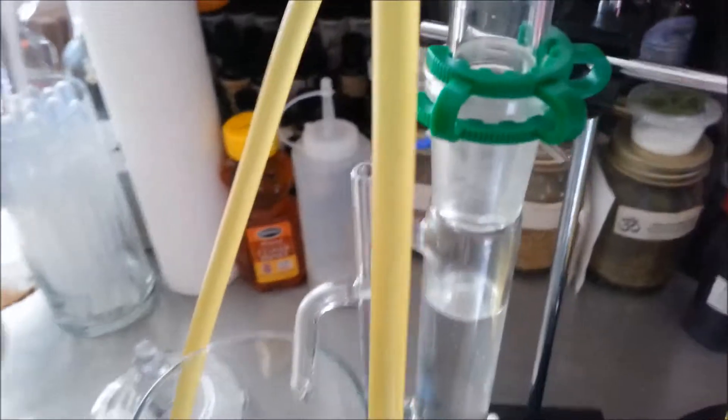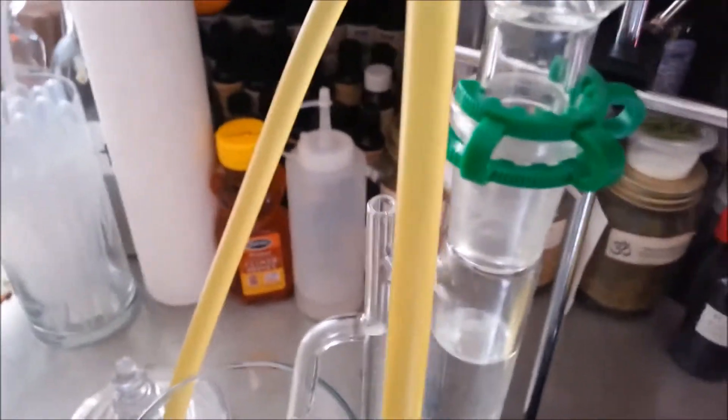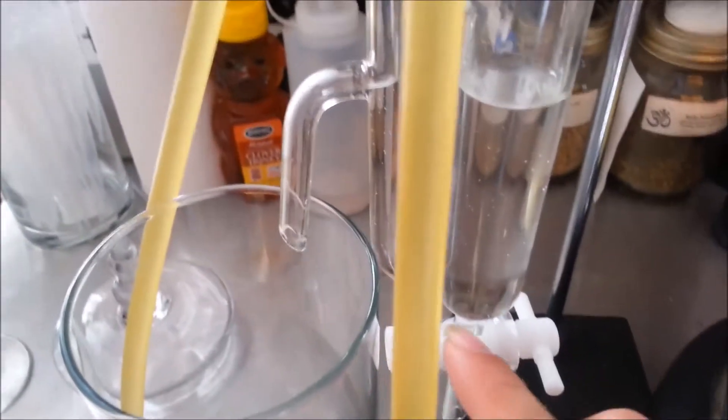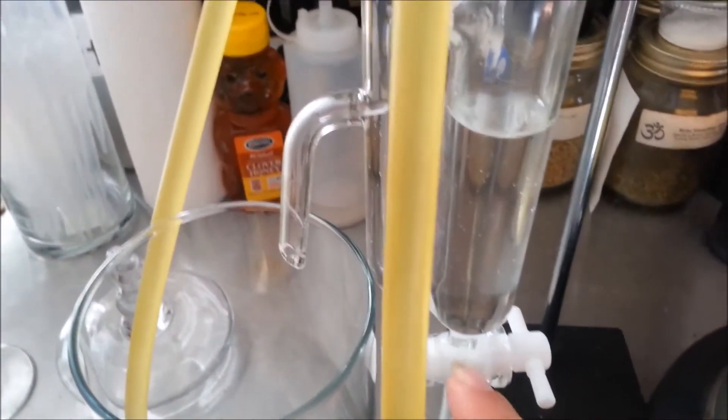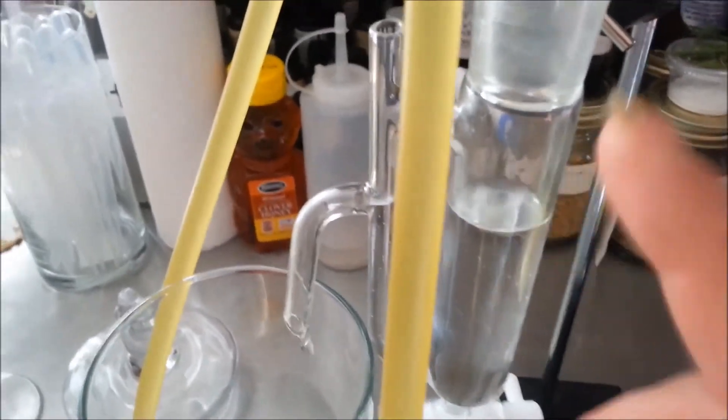This will make sure that you don't get any water inside of your oil. Some people like to pour just enough so that the oil is inside the hole on the stopper and then close the stopper, so you get mostly oil and no water whatsoever.